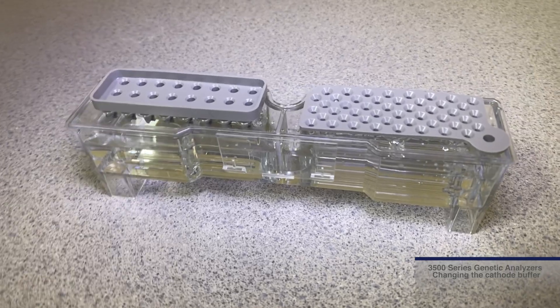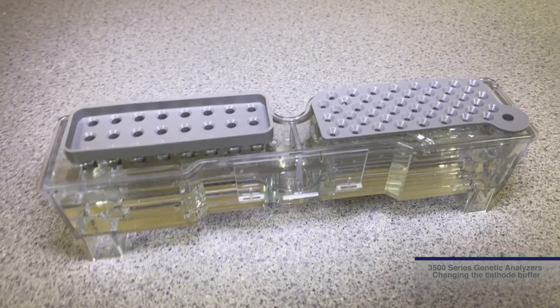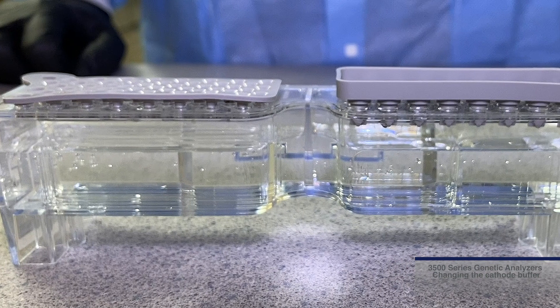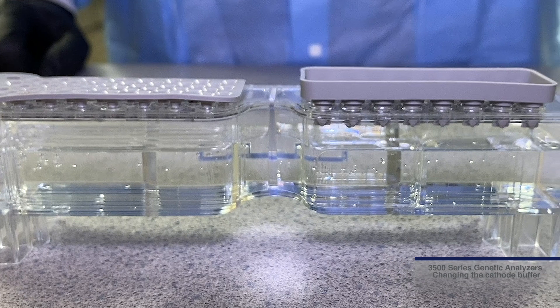It is recommended that the SEPTA be changed at least monthly. However, some labs change the SEPTA with each new cathode buffer container.